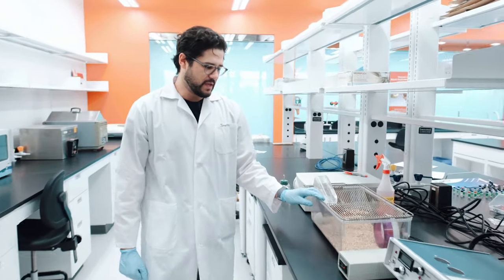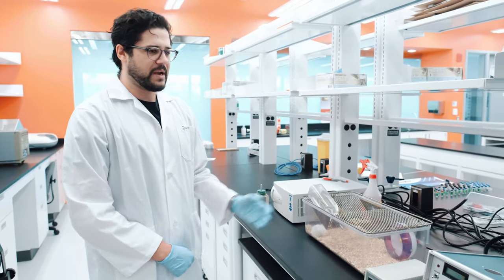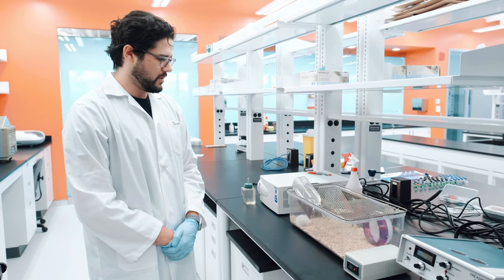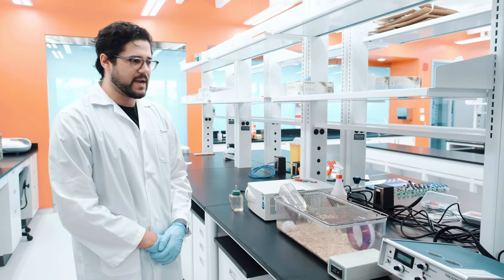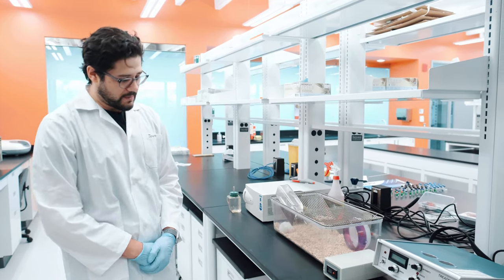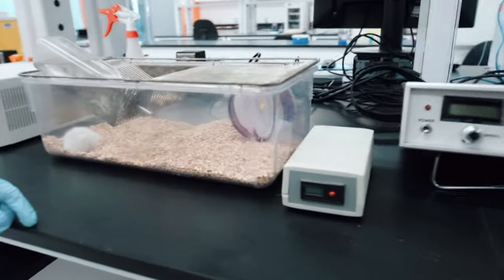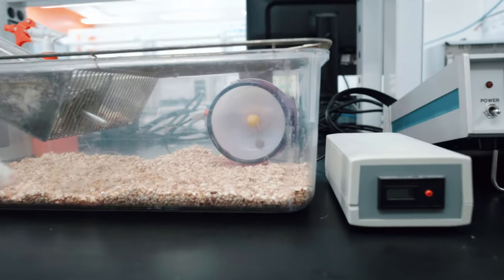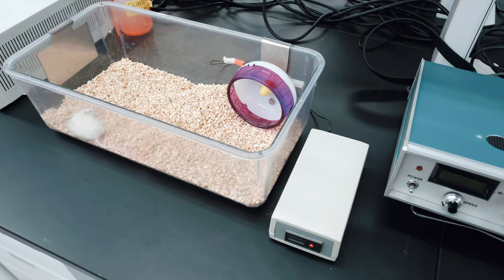Over here we have the running wheel, another model of exercise. The benefit of the running wheel is that it's far less stressful for the animal — they're allowed to run whenever they desire. Right now it's daytime so the animal is sleeping, but at night they get on the wheel and run quite a lot. We have the wheel inside the cage and a counter hooked up to it, so with every revolution we're counting the distance the animals are running. With the wheel it's purely voluntary, so we can't motivate the animal.